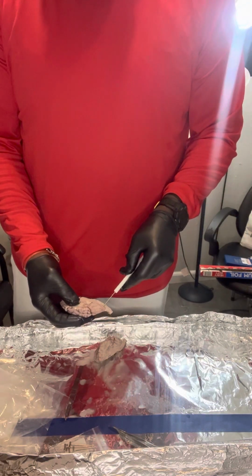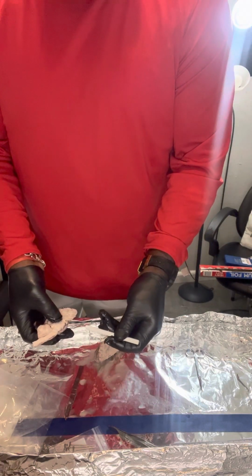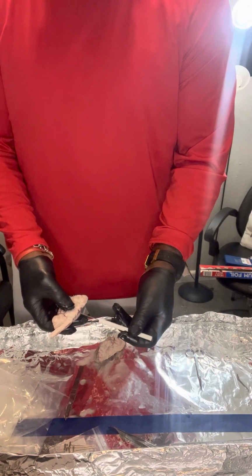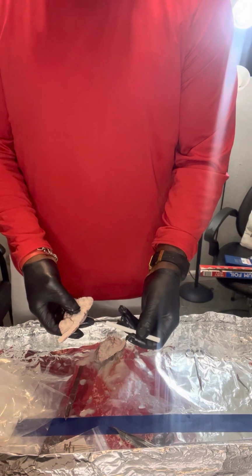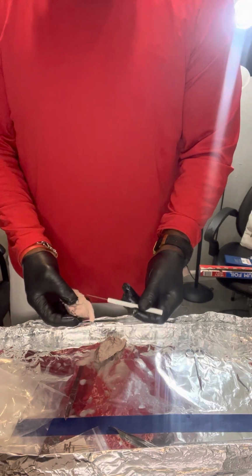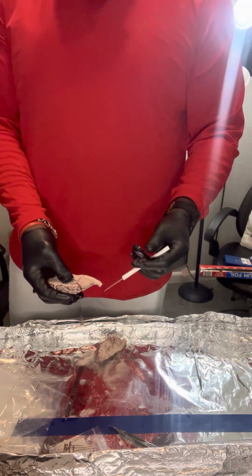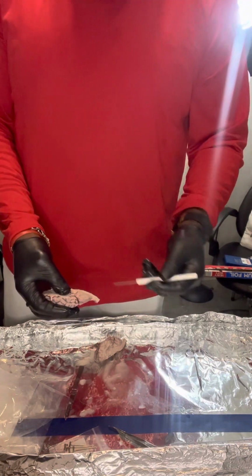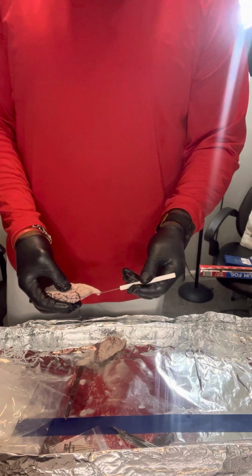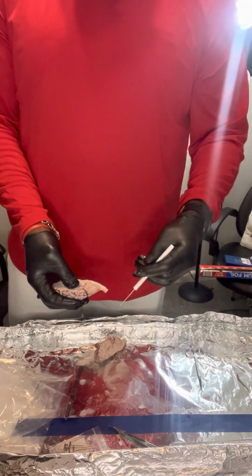The optic nerve is here, to be exact. Strangely enough, it sticks out for whatever reason like a sore thumb. The optic nerve relays messages from your eyes to your brain to create visual images. And finally, the central canal. In the event of an injury, the central canal helps to transfer nutrients to the spinal cord. But me not being a specialist at this at all, I suspect that there's nutrients coming from the central canal to the spinal cord at all times.